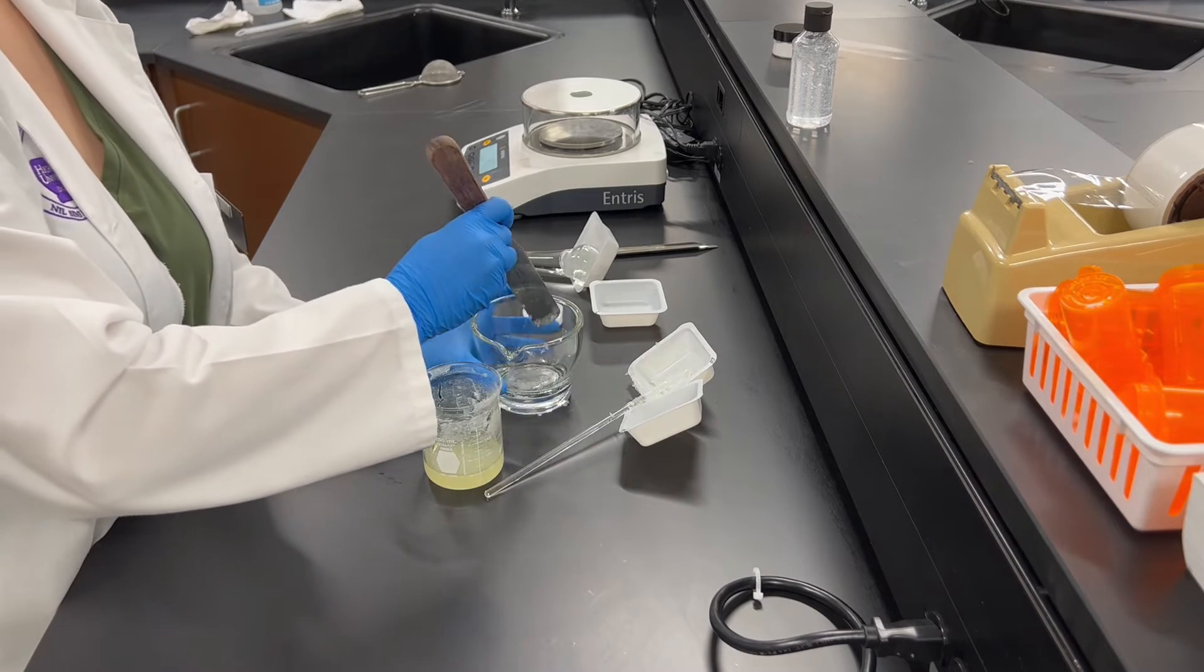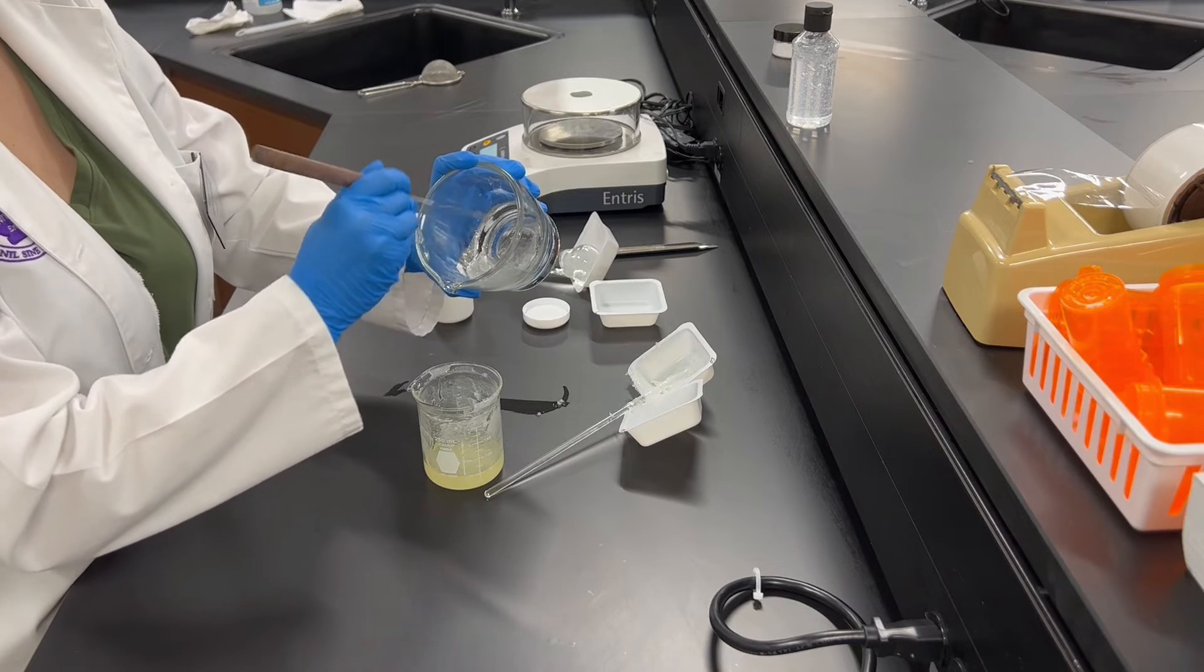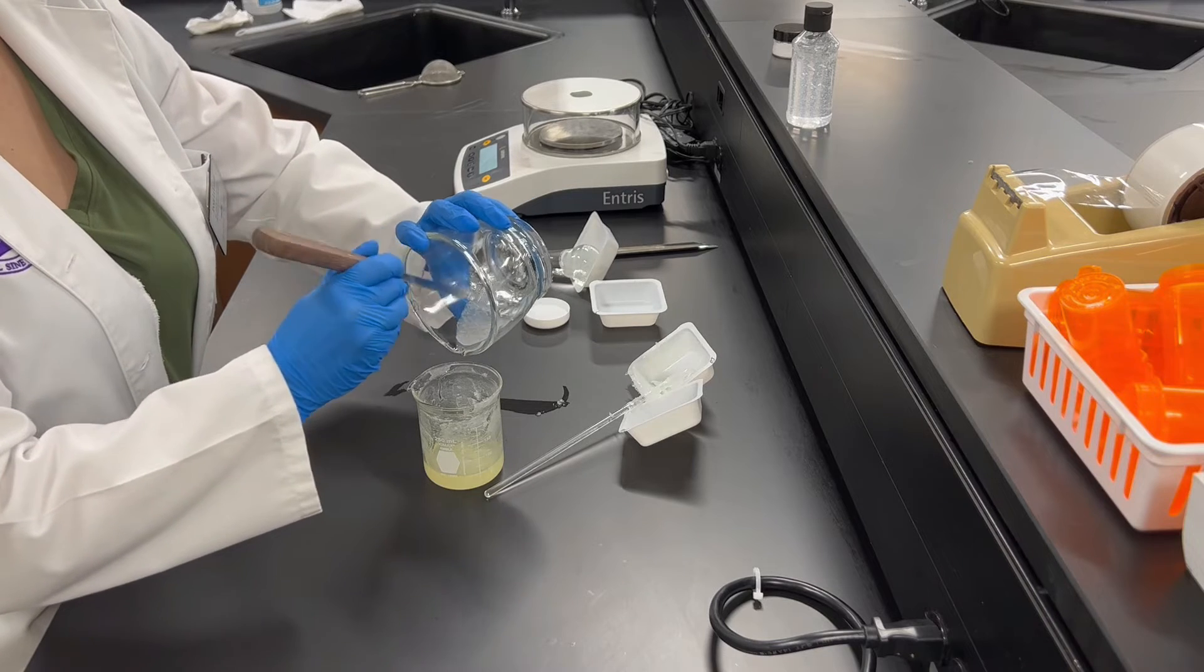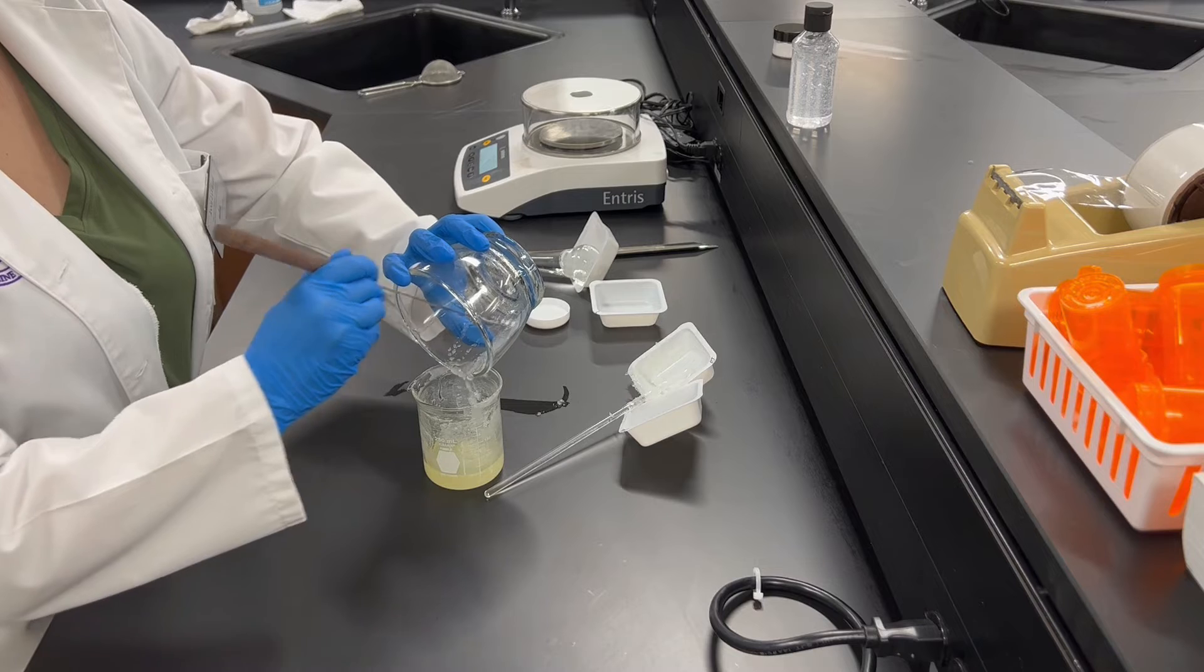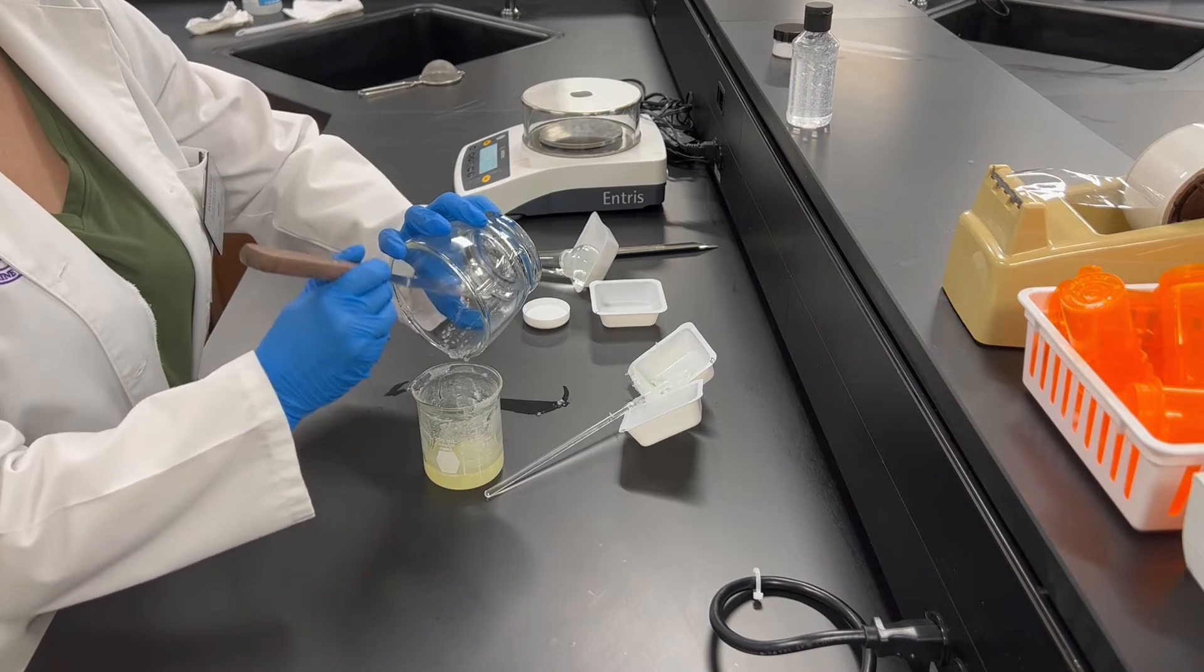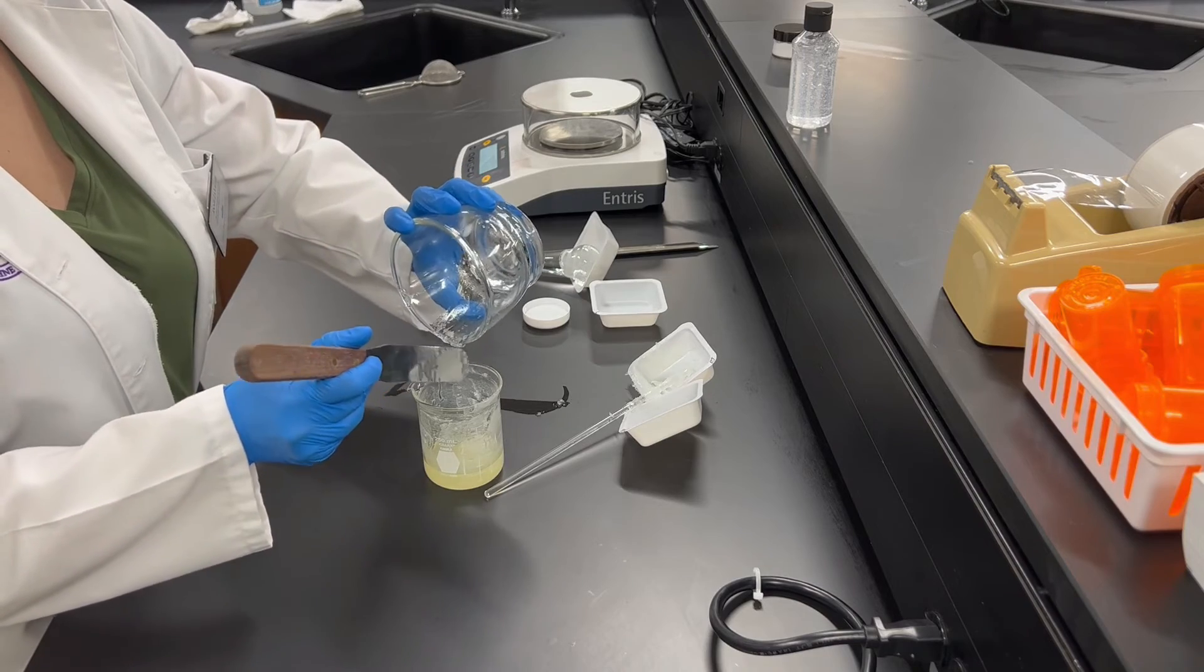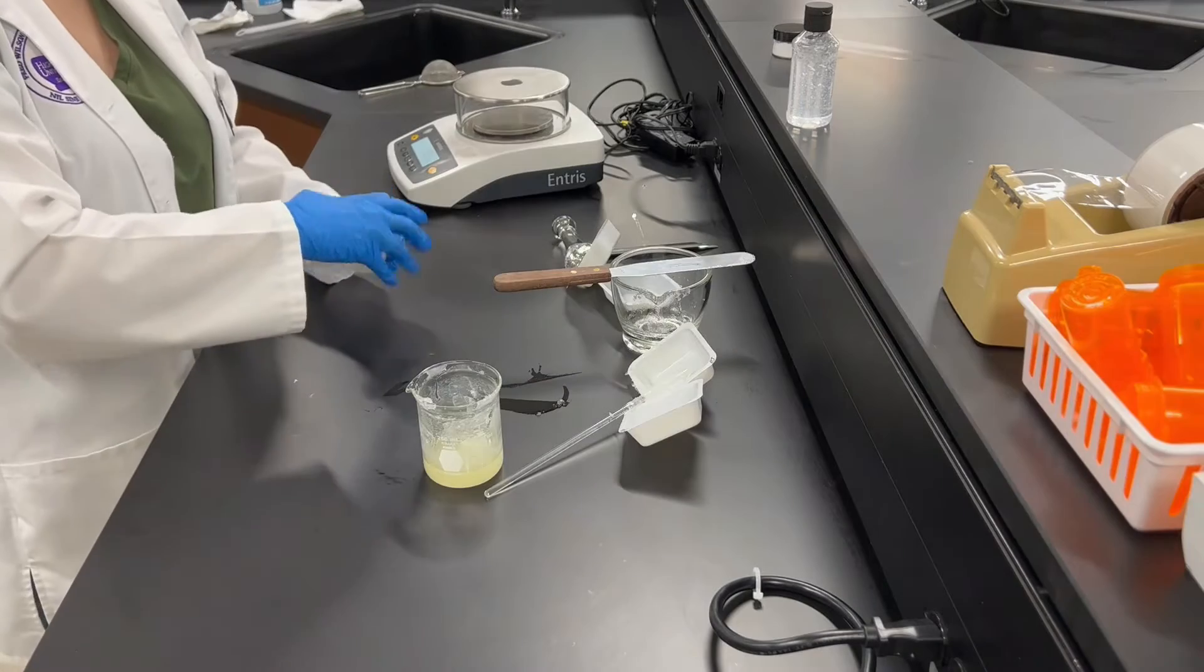Usually the best way to do this is to take your spatula to get everything out, as it does make it a little bit easier. Once you have emptied that out, you are just going to go ahead and stir all of those four ingredients together.